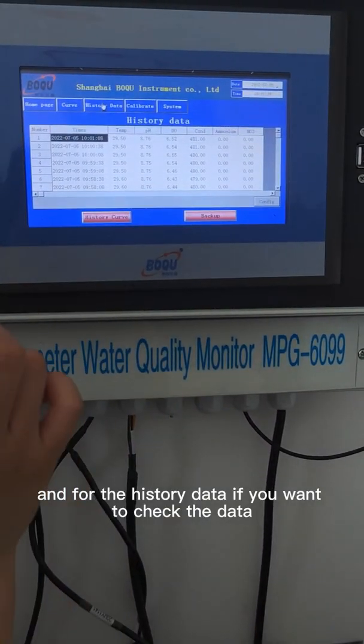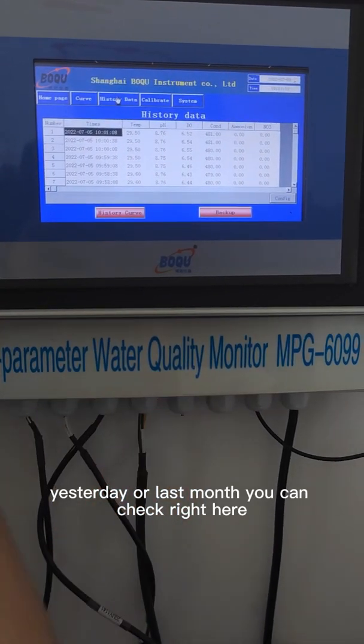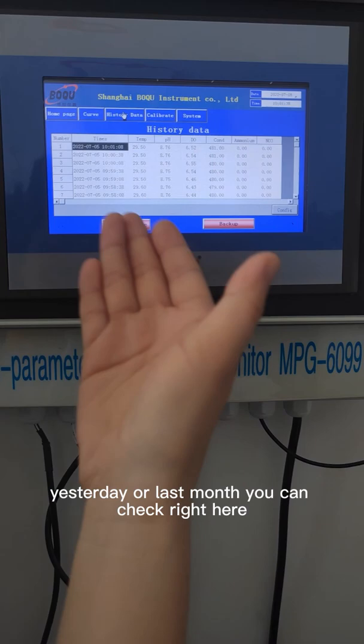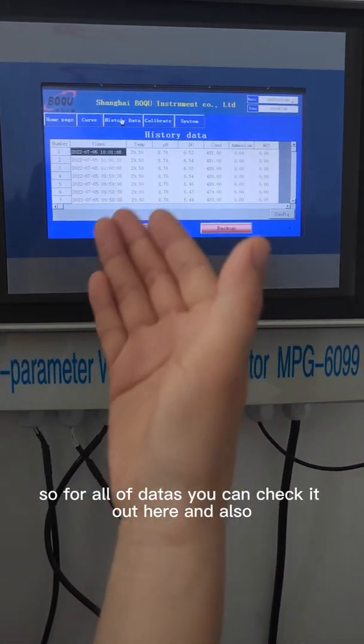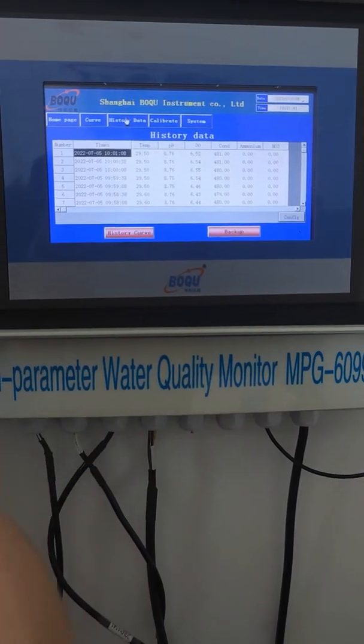For the history data, if you want to check the data from yesterday or last month, you can check right here. All of the data you can check here and also export it.